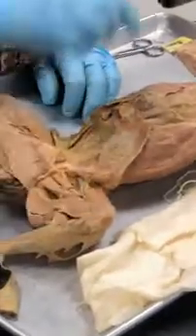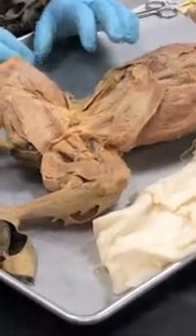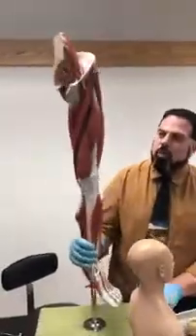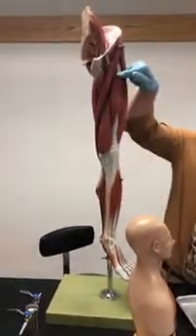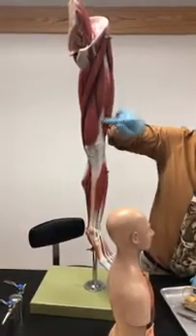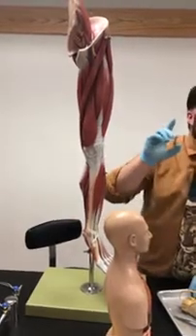But let's start off by things you already know. I would imagine you know the hamstrings and the quads pretty well, so let's start off with that, okay? So here we got, and I'm sorry about the squeaking, so here we got our quads. And keep in mind, this is the left leg, so this is lateral, and this is medial. So we have a muscle here in the quads. What is this middle one called? Rectus femoris. Rectus femoris.